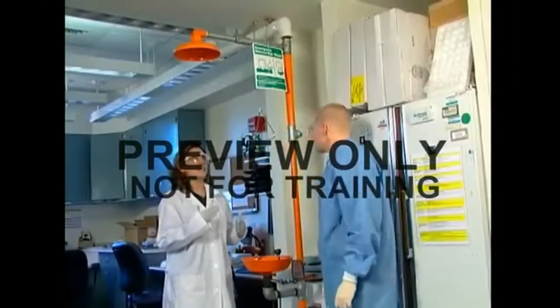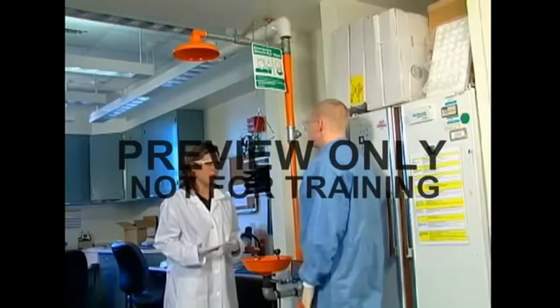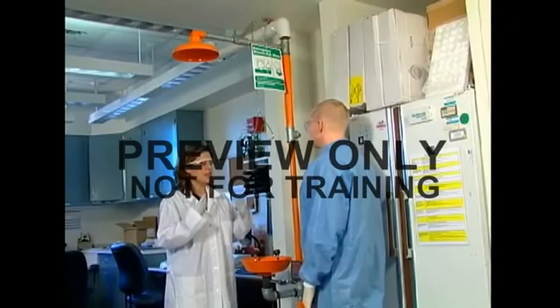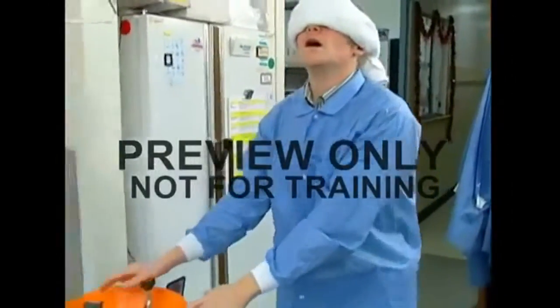No matter how safe you think you are, you should know the locations of the safety showers and eye washes in your area and how to use them. In fact, you should know how to find them with your eyes closed.